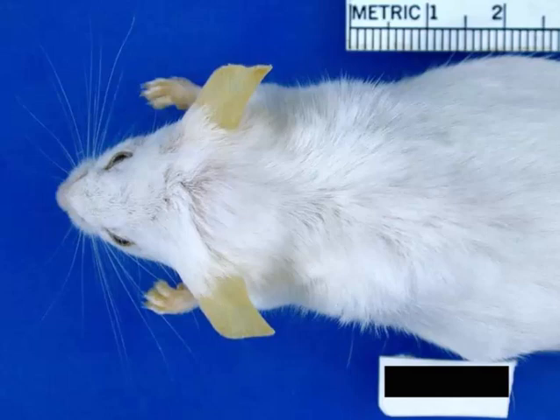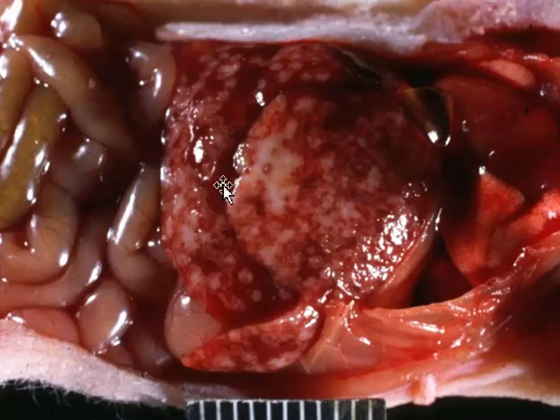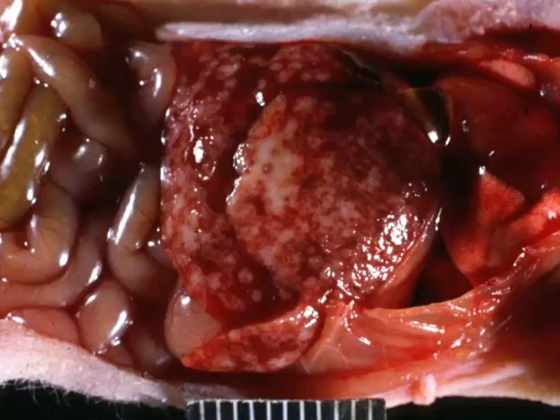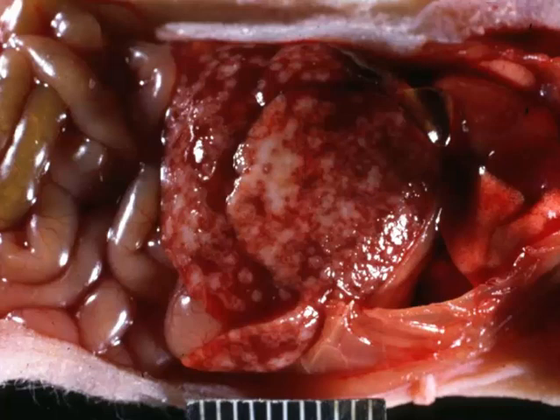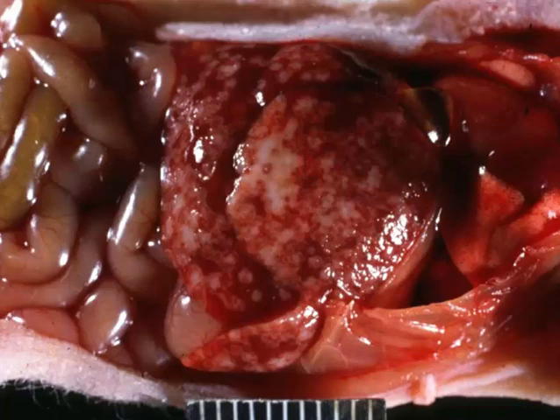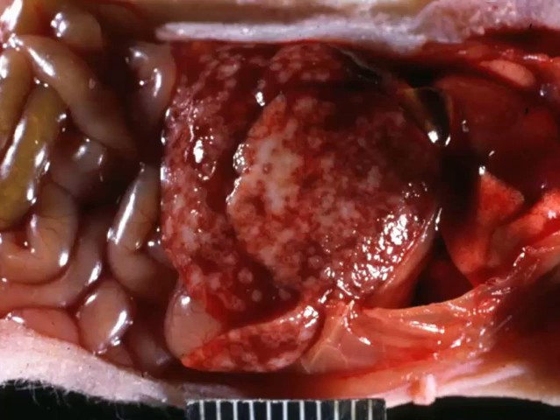Let's take a closer look at some of these agents. Here's an absolutely terrible-looking liver with large confluent areas of necrosis — it is moth-eaten, and we're looking at a nude or immunodeficient mouse. One of the scourges in the early days of nude mouse development was the polytropic mouse hepatitis virus, a coronavirus. This lesion isn't specific for that — I'm just using it as an example. The coronavirus that causes mouse hepatitis virus in immunodeficient mice targets a wide range of cells, including hepatocytes, endothelium, cells in the bone marrow, and lymphocytes in multiple lymphoid organs, but some of the most profound lesions are seen within the liver.